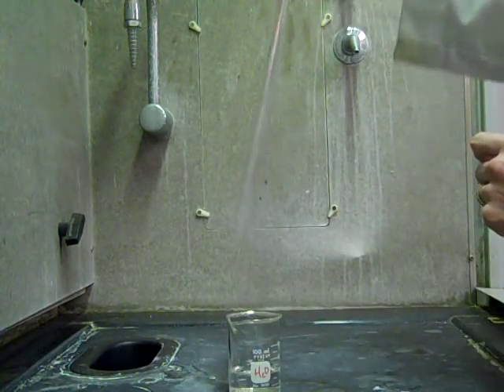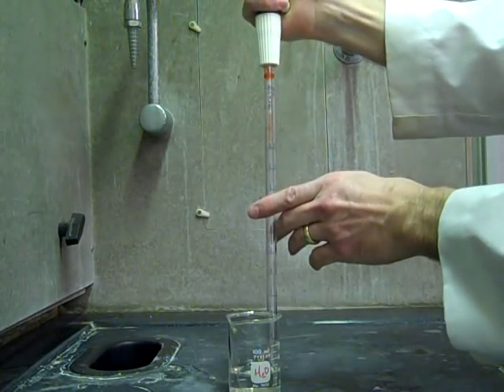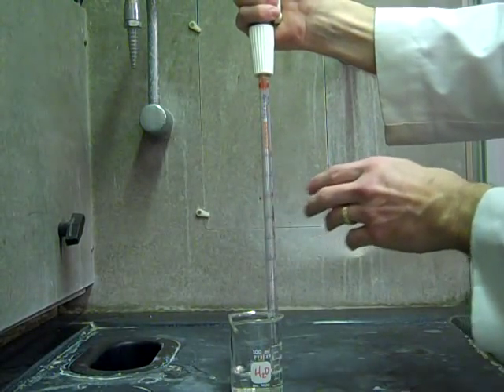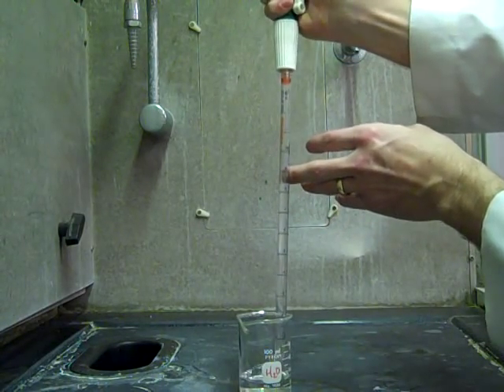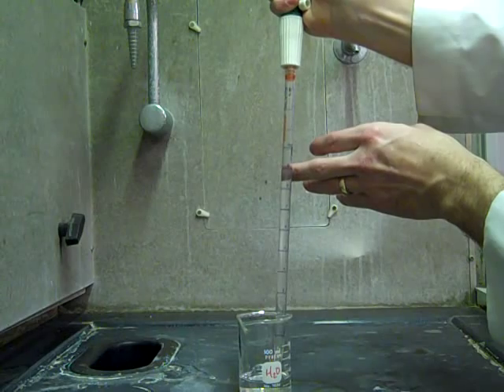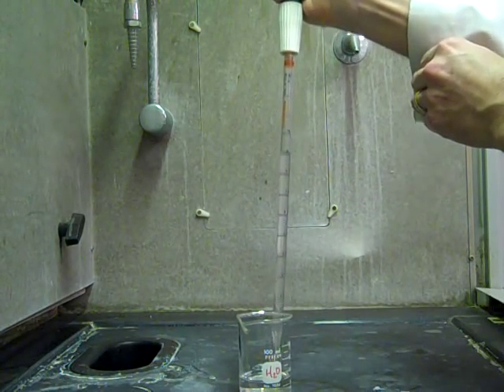You have the roller ball at the top and you roll it down which brings the liquid up. So let's say we're getting up to 9 milliliters, you take it up to the 9 on this one side and then of course you want the bottom of the meniscus.